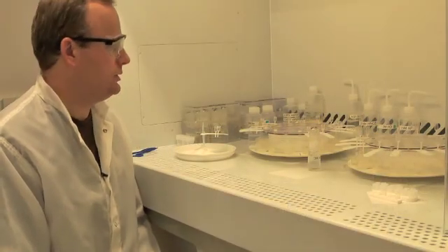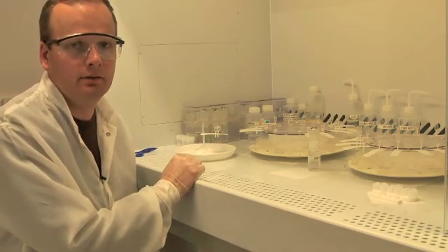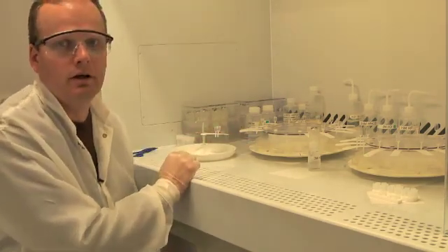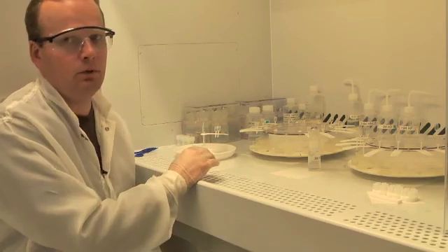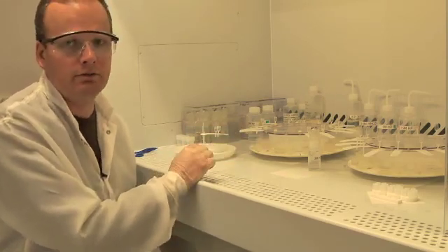I finished cleaning my columns using a combination of water and 6 molar hydrochloric acid. I'm now setting them out under the hood on these Lazy Susans. This setup allows me to do many column separations at one time, up to 30 different columns, 30 different samples.